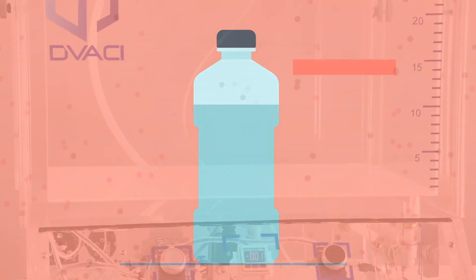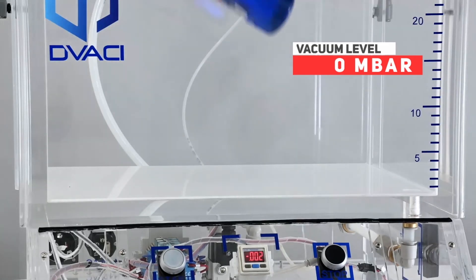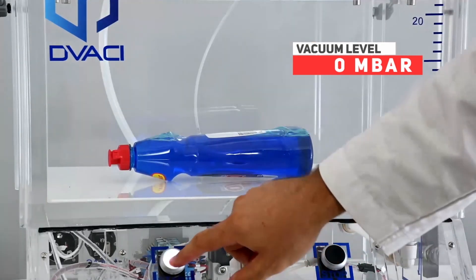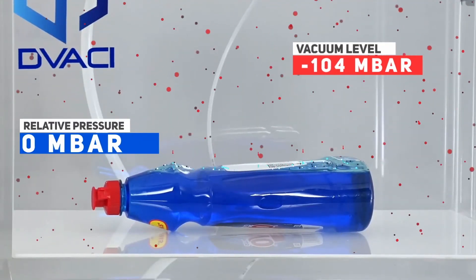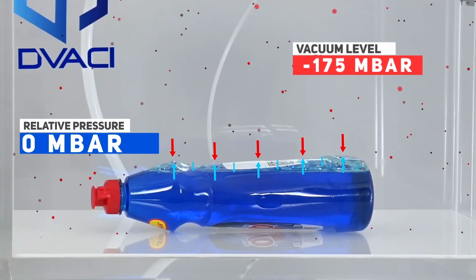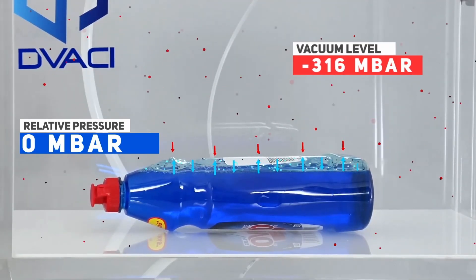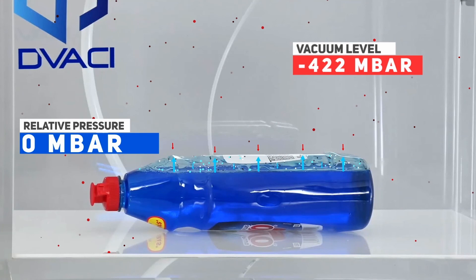When a product is placed inside the CDV and vacuum is created inside the chamber, the amount of air molecules surrounding the package will decrease, creating a pressure difference and making the air inside the package expand. This will exert a force upon the walls and seals of the package.